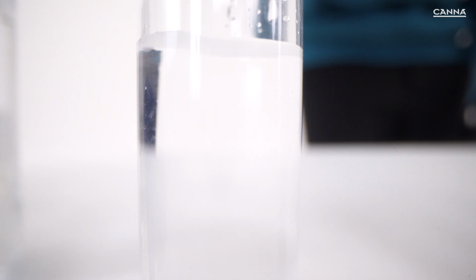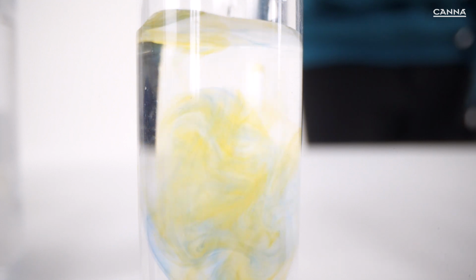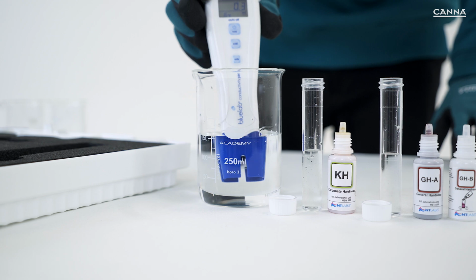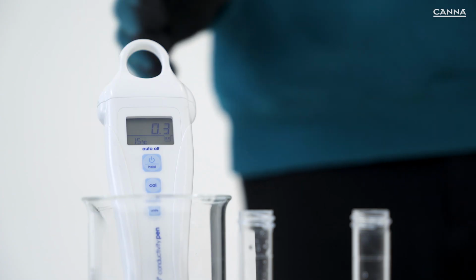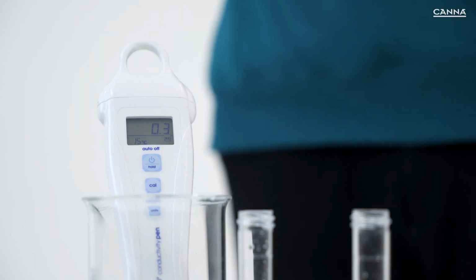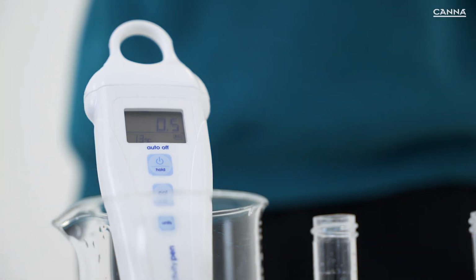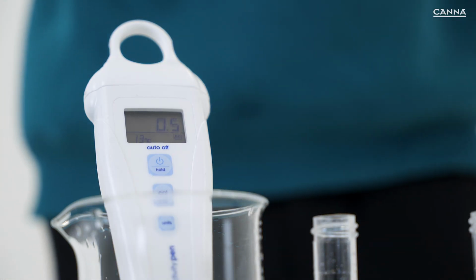The drop count information recorded indicates the type of water you have. Using this information, you can determine the quality of your water source and make any changes required. If you record an EC from 0 to 0.3 with a carbonate hardness and general hardness of 6 drops or less, then you have soft water. The lower the readings, the softer your water. If you record an EC between 0.4 and 0.5 with a carbonate hardness and general hardness of between 6 and 10, then you have normal water.